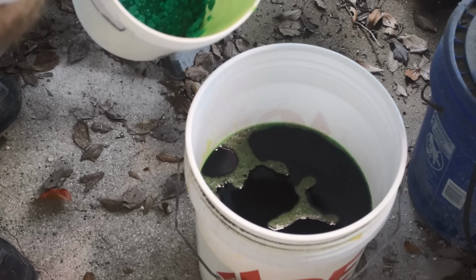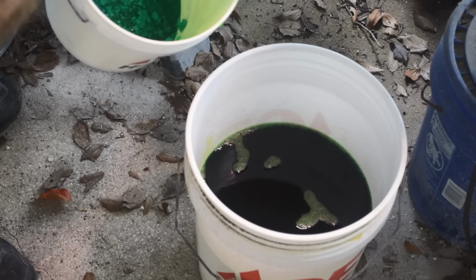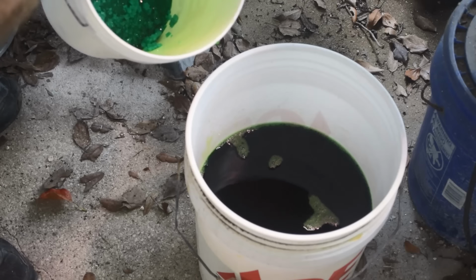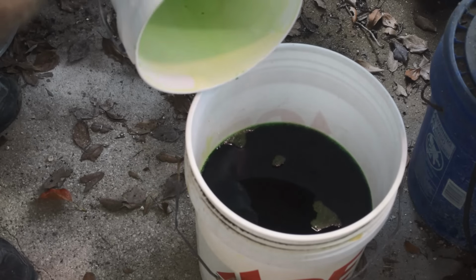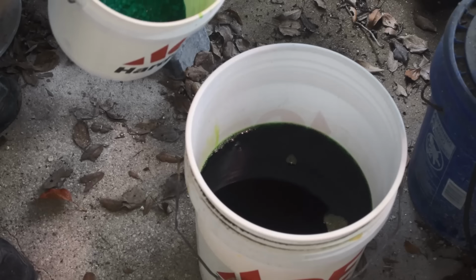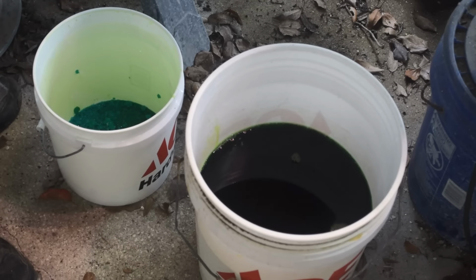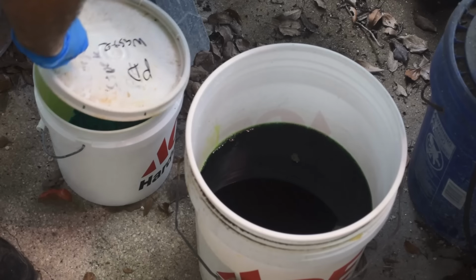I might wash those with some muriatic acid. Try and get some of the color out of them and dump that in, just so that I get as much of the precious metals out of here as I can. Then I'll discard the rest of the solids. So that's my idea for that.